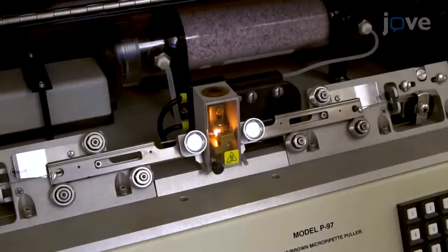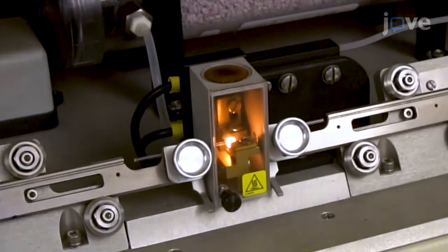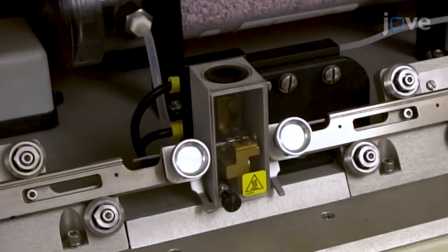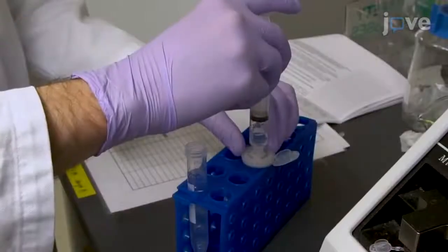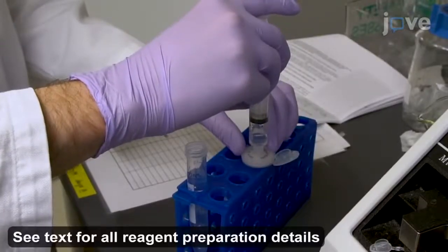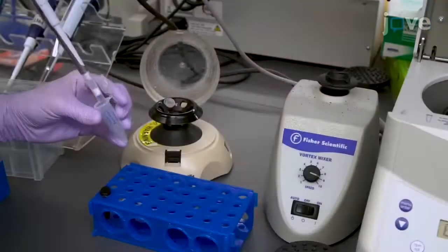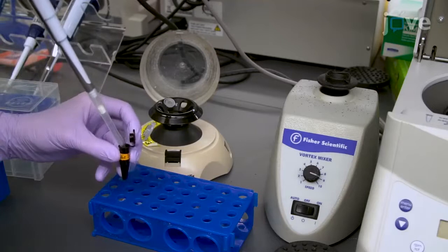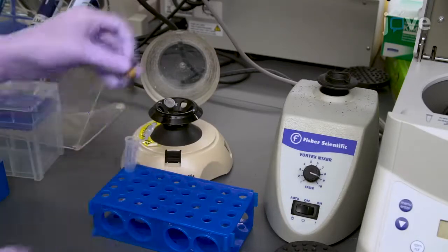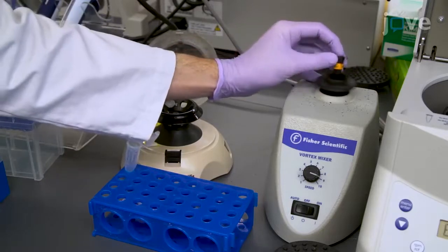Before beginning the procedure, use a programmable pipette puller to pull a glass micropipette with a 20 to 40 micrometer opening diameter. Strain approximately 1 milliliter of recording solution through a 0.22 micron filter, and resuspend enough lyophilized photoactivatable nicotine in the filtered recording solution to yield a 2 millimolar final concentration.